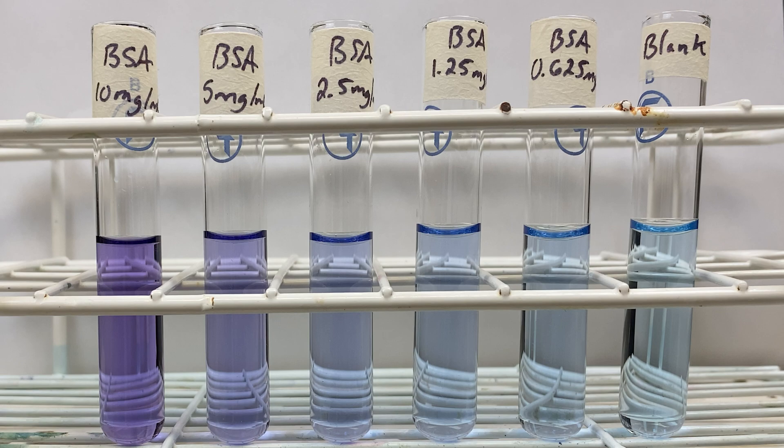As we add more protein, you can see the color changes to a more purple color. In this lab, I will demonstrate adding protein to the Biuret reagent, and you can see the colorimetric reaction.